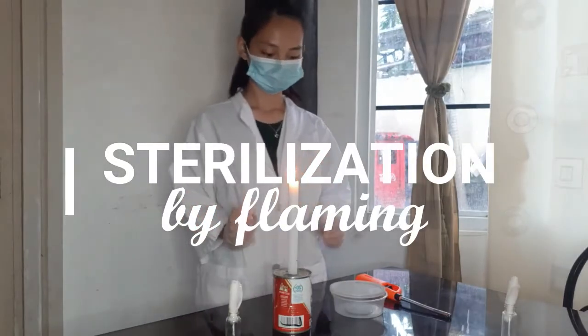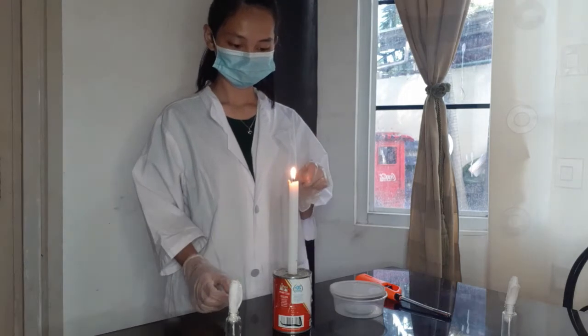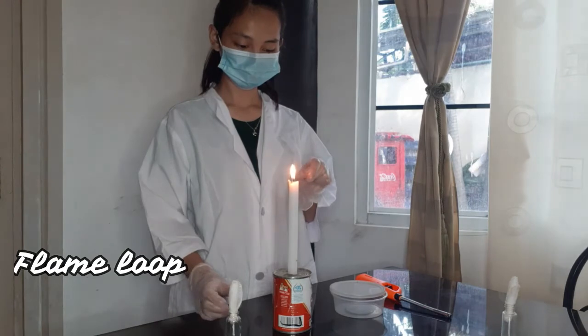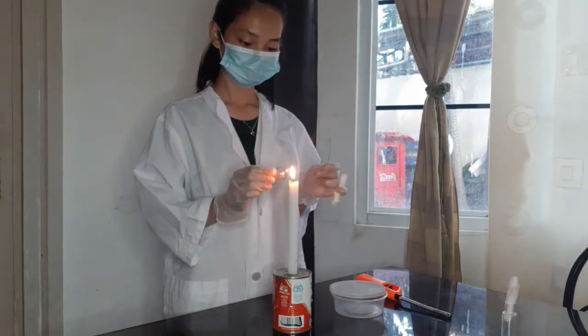And the second option is sterilization by flaming. There are rules to follow when doing this technique and the rules are on the screen. The first thing to do is to flame your loop. Second is to remove the plug and flame the tube.